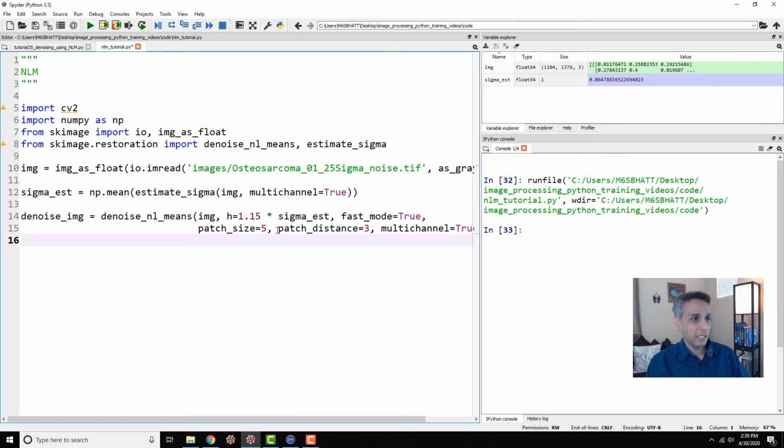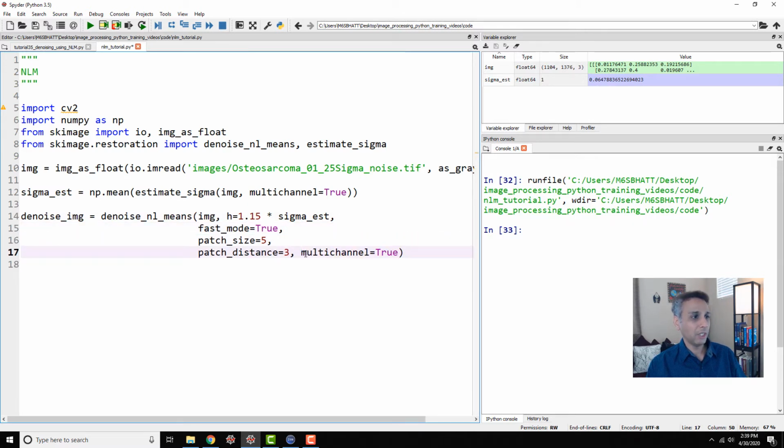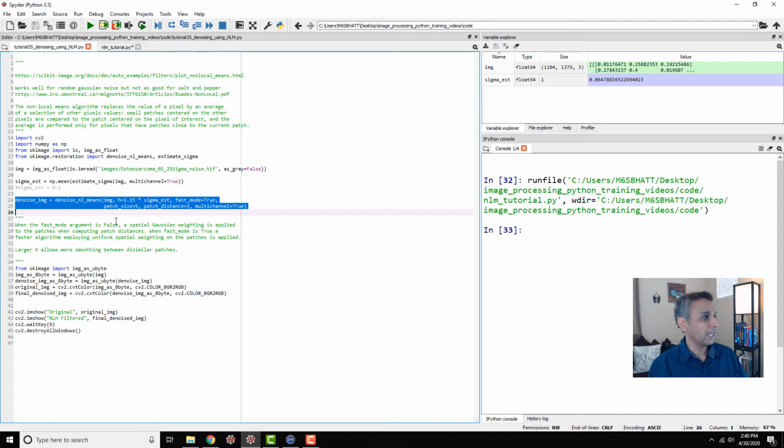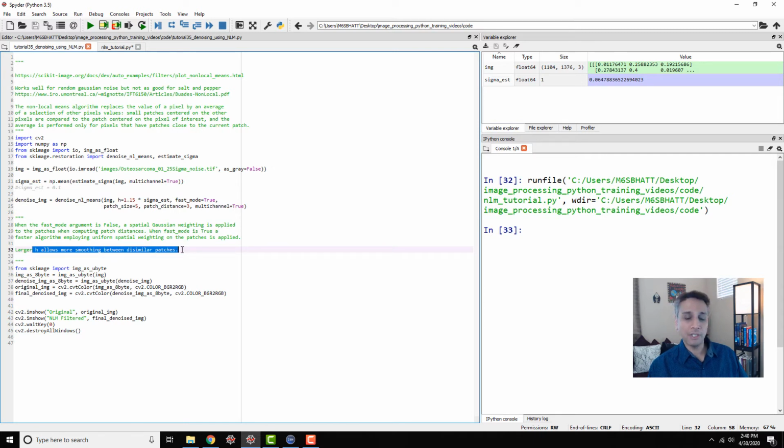Let me unwrap this a little bit so it's easy for you to see. Okay, so first of all, I'm going to call my denoise non-local means, NL means. The first parameter, as usual, is our input image or NumPy array. The next parameter is H. Again, you can look at what these parameters mean in the documentation. I've written a quick note: larger H allows more smoothing between dissimilar patches. So if you select a larger H, when the patches are dissimilar, there is a bit more smoothing happening within each patch. That's what the parameter H refers to.